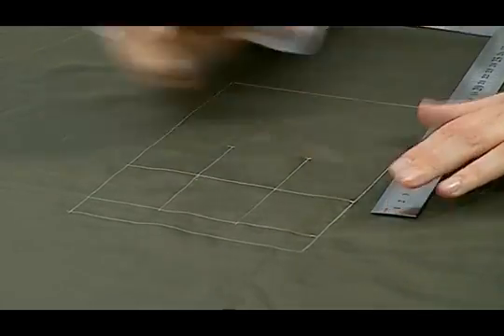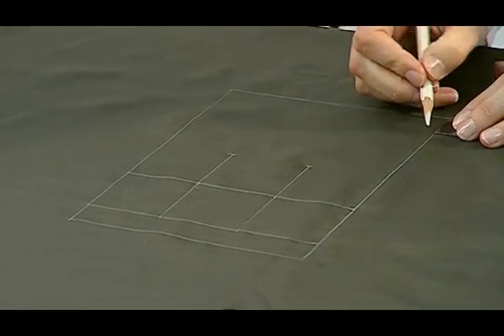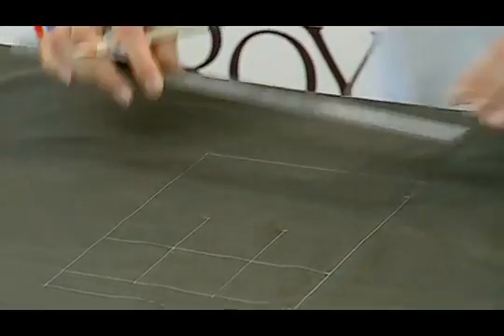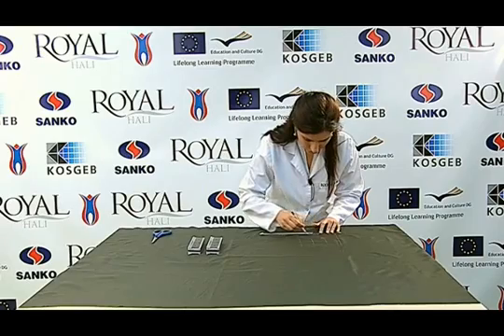25 mm are marked from the lower part of the sample, which was not marked earlier, and the last point of the shearing action, that is, the end line of shearing, is drawn.